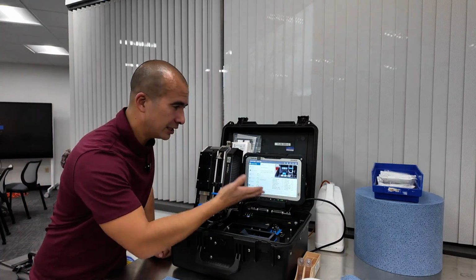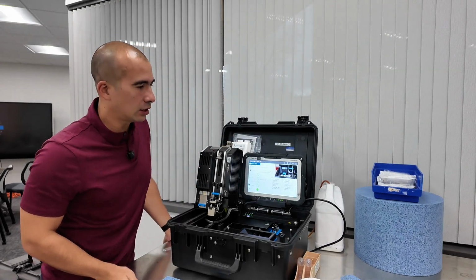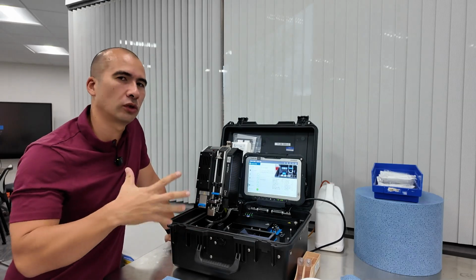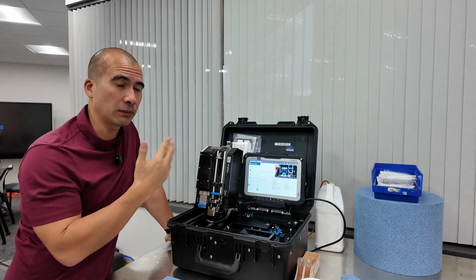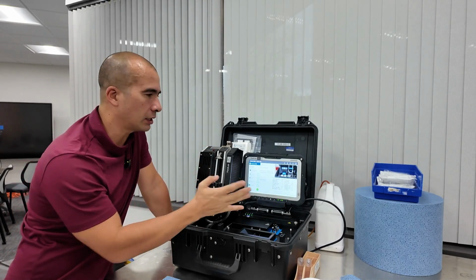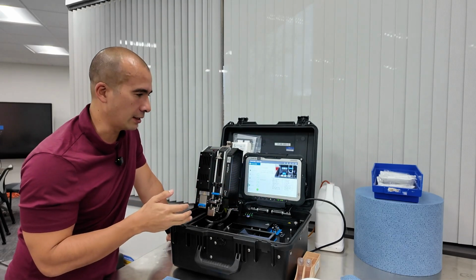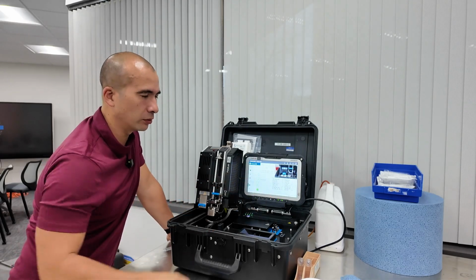All right, and now our test is complete, and we have all the elements that an XRF can measure, which is basically anything from magnesium down. That's the restriction on XRF, that they can't really do lithium and the lighter elements. But that's fine because for the purposes of wear metals, that pretty much gives us everything we need. So we've got aluminium, silver, cobalt, chromium, etc., all the way through to zinc.